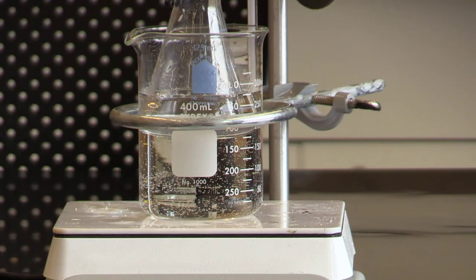The Erlenmeyer flask, as you can see, is pretty much completely submerged within that water bath, along with our thermometer in there as well so we can regulate the temperature.